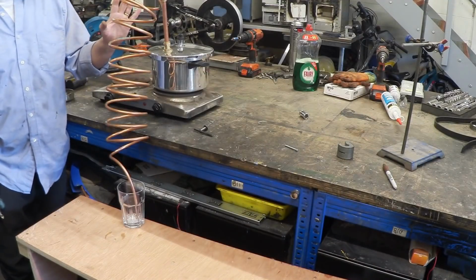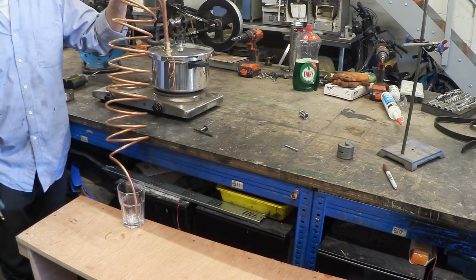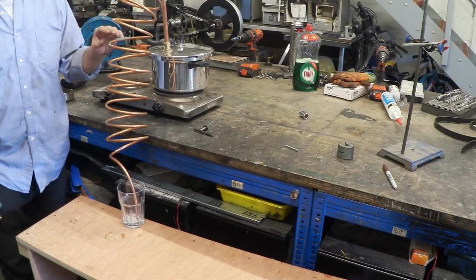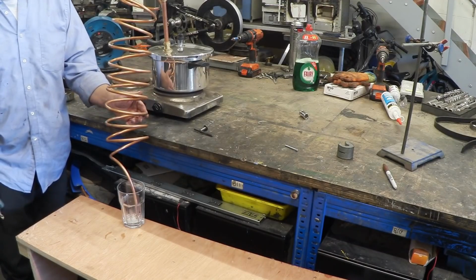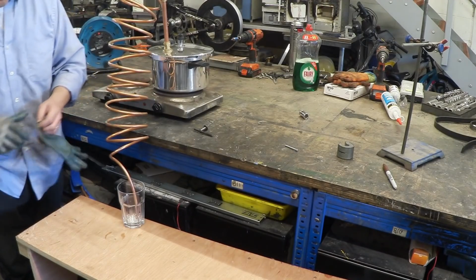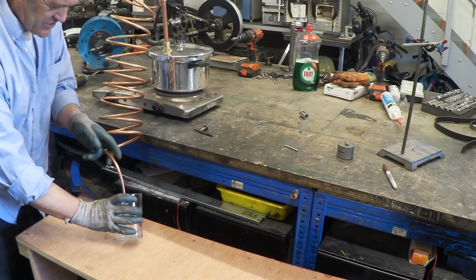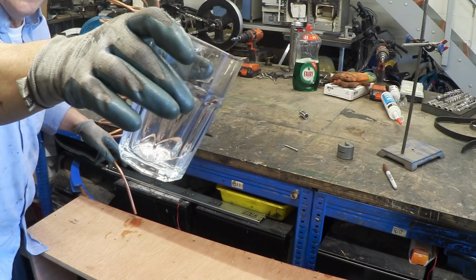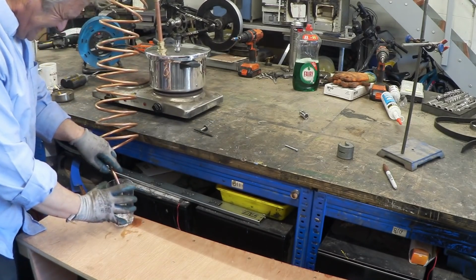Okay, so I've changed the angle of this because when the gas turns back into liquid, if the angle is too steep, it's going to be pushing against gravity around these coils, which is a bit much. So I put this angle in there so that there would be freer flow by the time it got to here and cooling. And we've been running this for about 5 minutes or so, and we have ourselves some essential oil, and there it is. Oh yeah. That's fantastic.